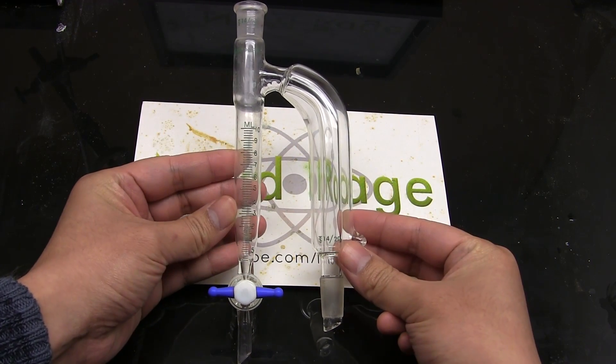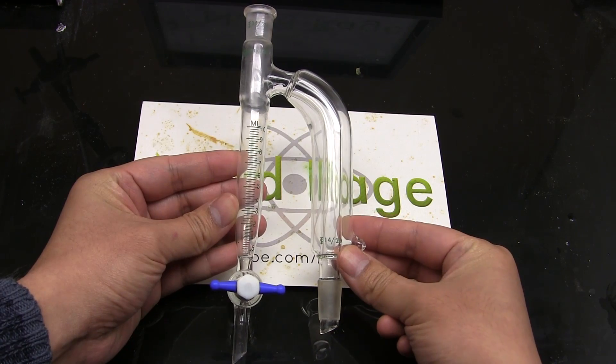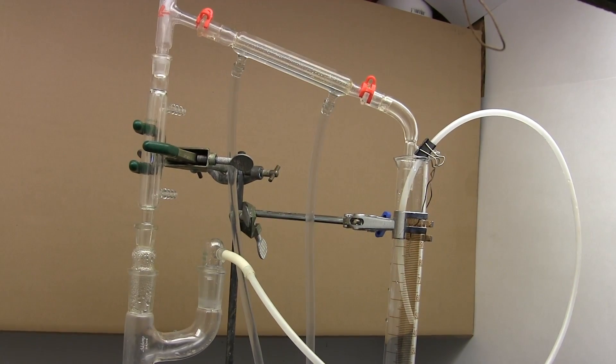Greetings fellow nerds. In this video we're going to explore and use the Dean-Stark trap, as well as construct a more versatile makeshift version.